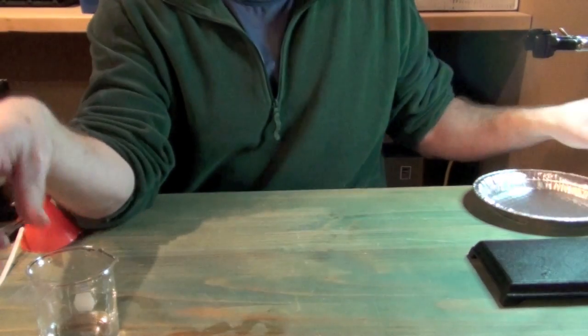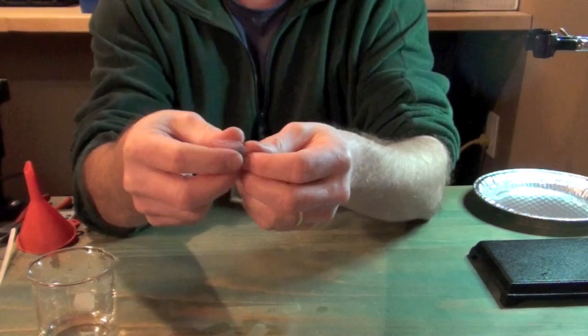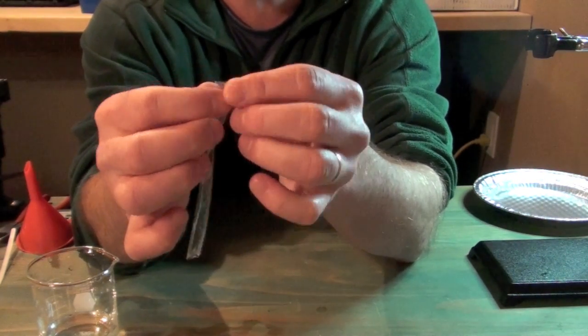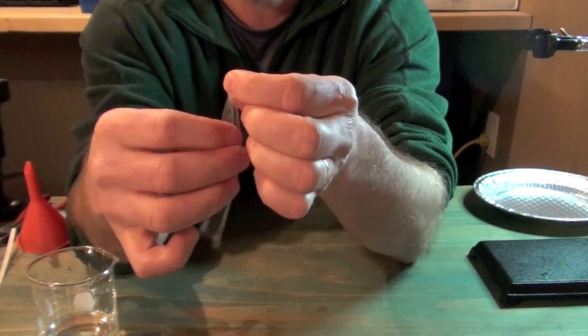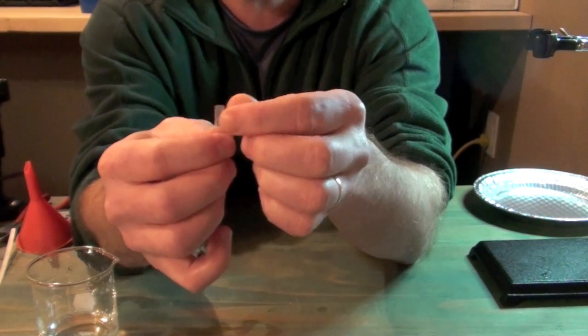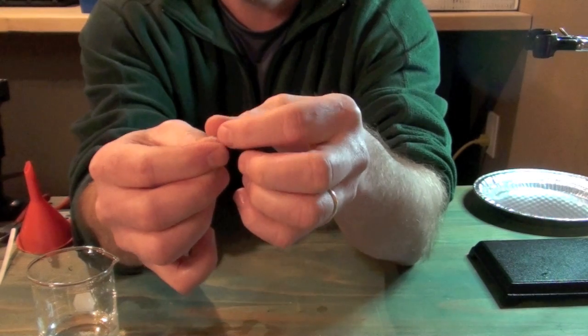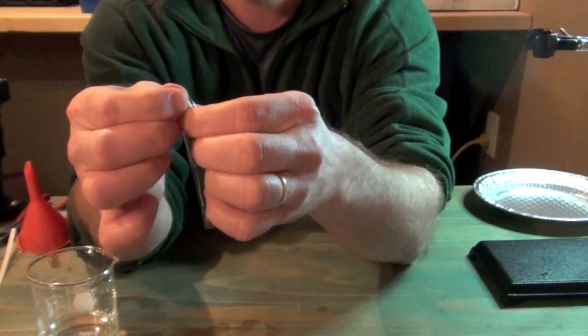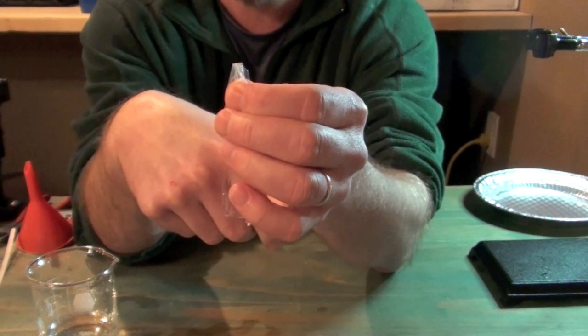So when we do that with our tubing, basically what we're doing is taking that end, folding it over again, and then we take that whole double folded end and fold it over on itself, just like that. So when we're holding it, we've got our double folded end just like that.